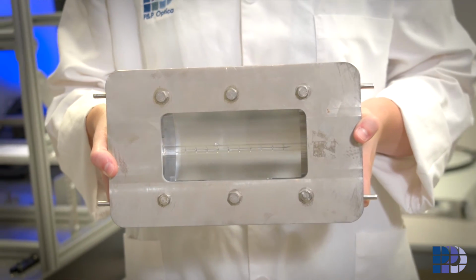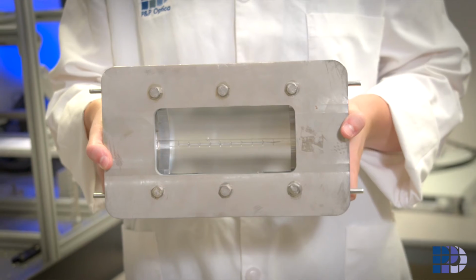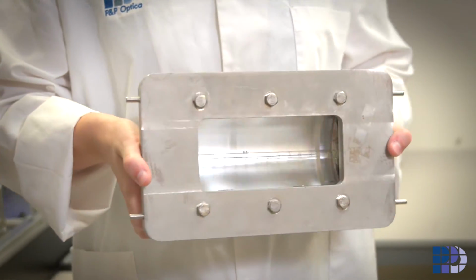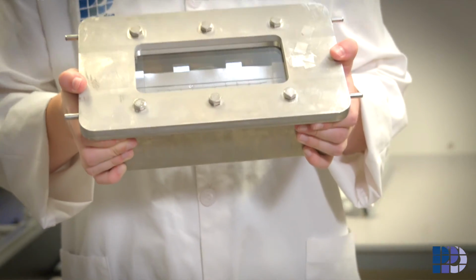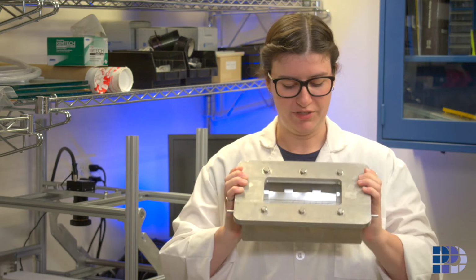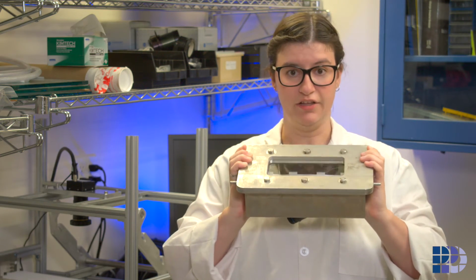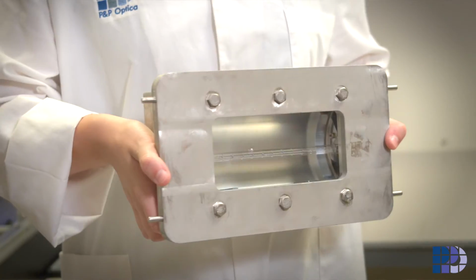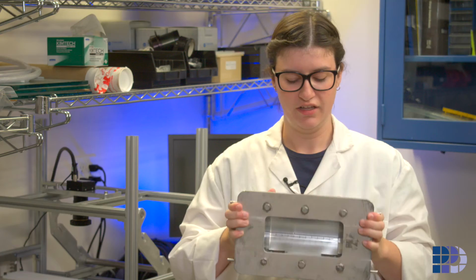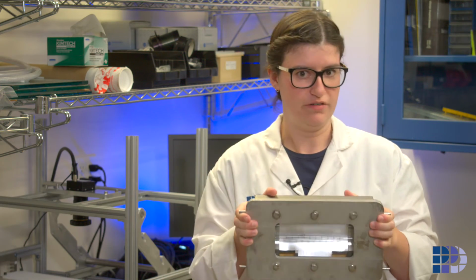So here we have an example of a fully assembled lamp with the window assembly and the back cover installed. The window type was selected because it has a high transmission, both in the visible and the near infrared range. The lamps were also designed to be washdown rated. Because these halogen lamps reach high temperatures during operations, the window material was selected to withstand the thermal shock and minimize the risk of cracking if the system is washed down right after it's turned off.